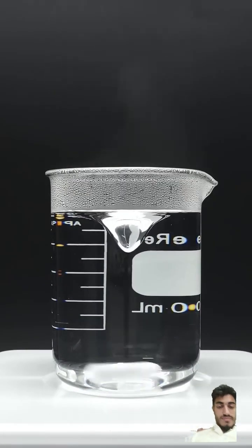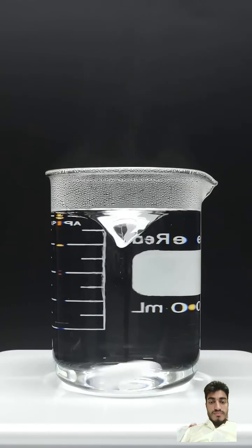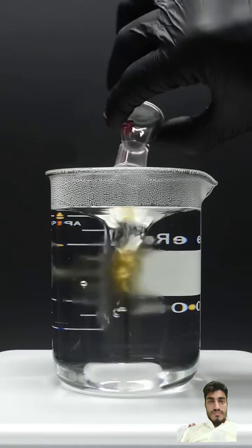This all dissolves really quickly, and on top of this, I'll add a bit of vinegar, and that little lead solution from before.